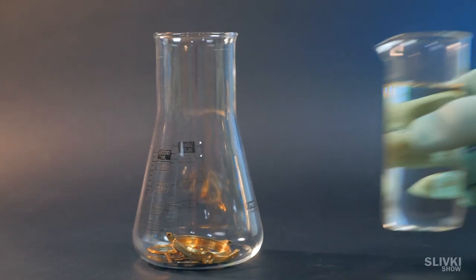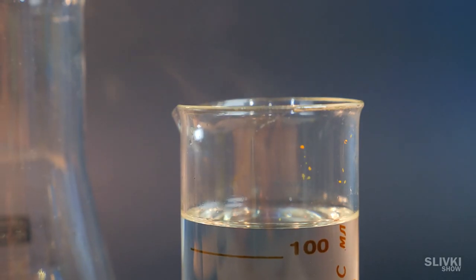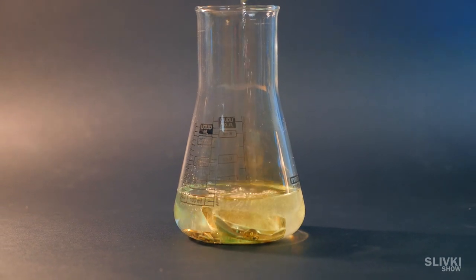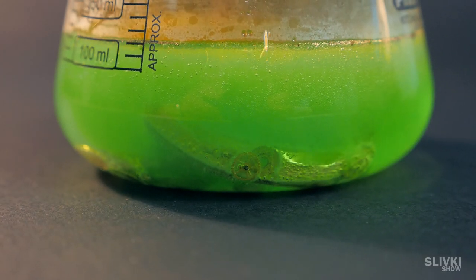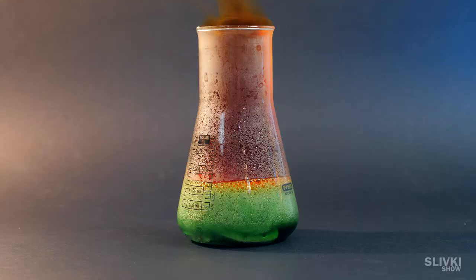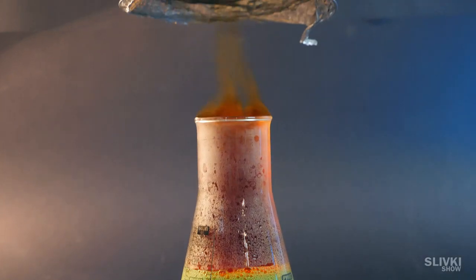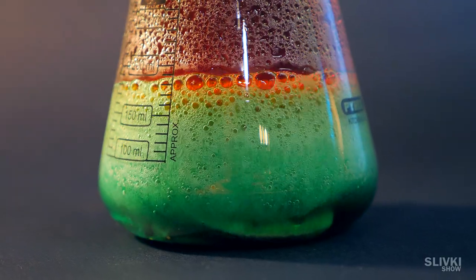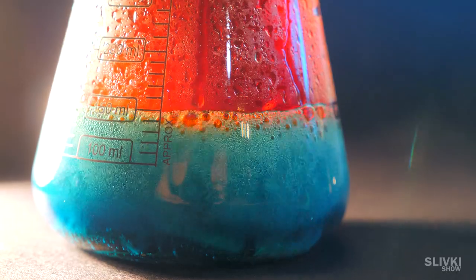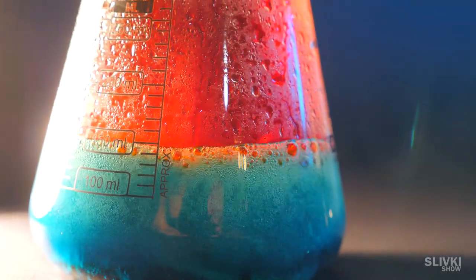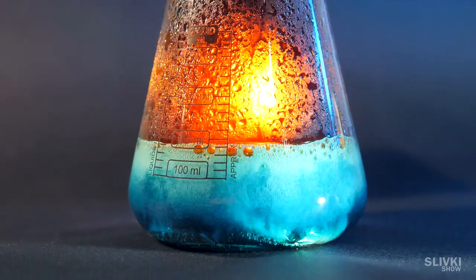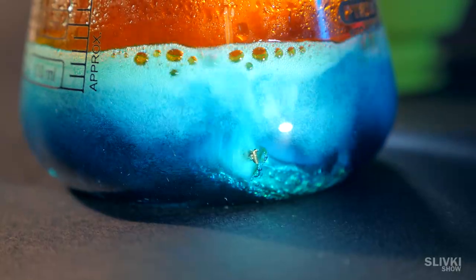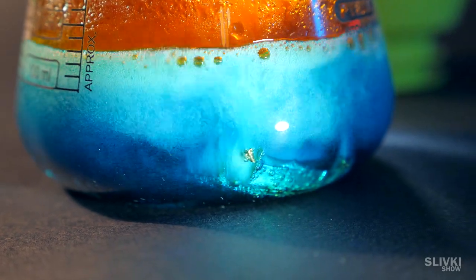We need about 100 grams of nitric acid, which we pour inside a flask. Right away, chemical reaction starts where it emits brown gas. This results from nitric acid starting to dissolve metals. The acid starts to change color from green to bright blue. It looks extraordinary.